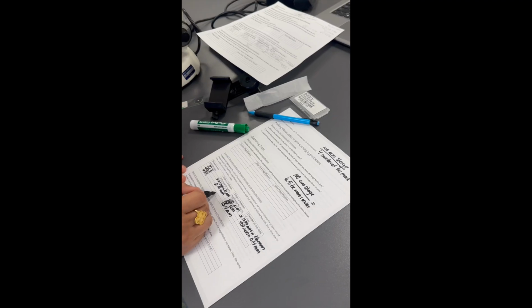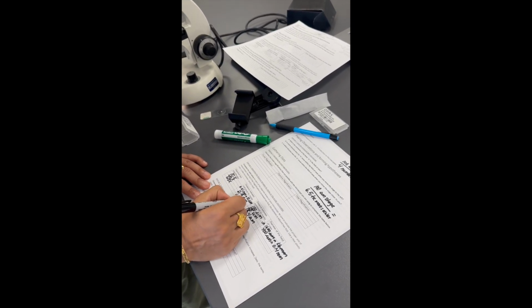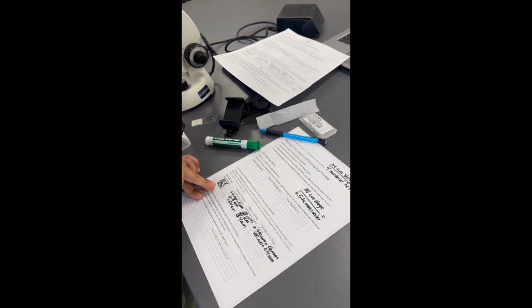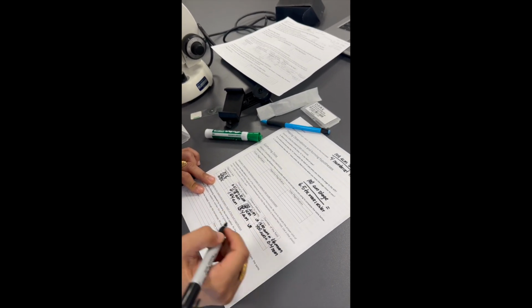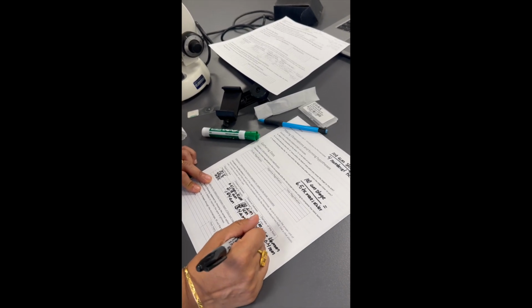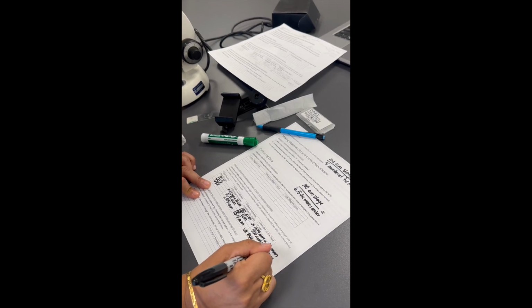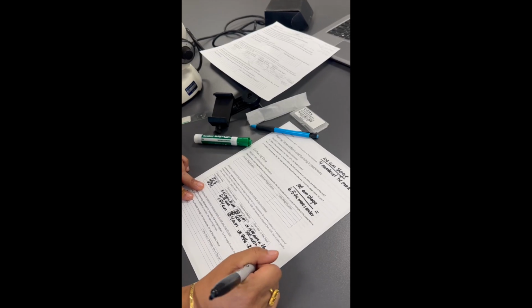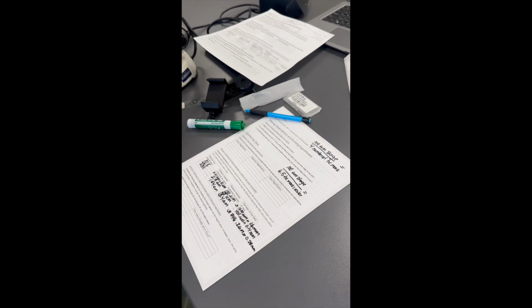And then again, this is 1/10, so it would be 1.54 micrometers for the distance between individual tick marks at 63x. And if we did our ratio here and multiplied by 16, we would get 246.2 micrometers for our diameter of field of view, which would be 0.25 millimeters.